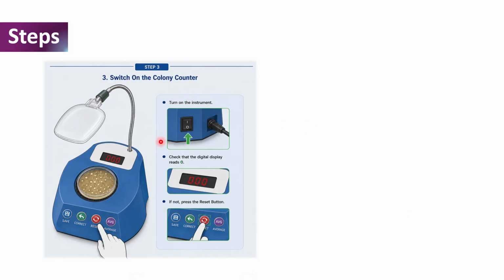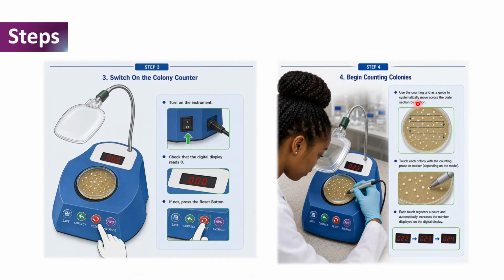And it is always important to check that the digital display reads 0. If not, we press the reset button on the colony counter to reset the display to 0 as shown here. And once this is done, we begin counting our bacterial colonies on the agar plate.